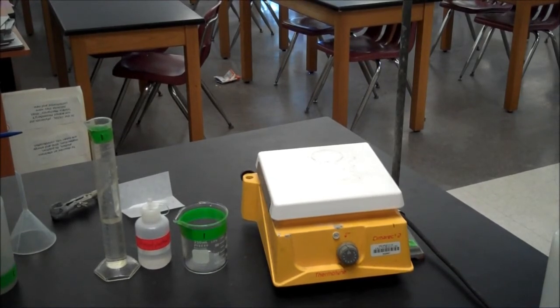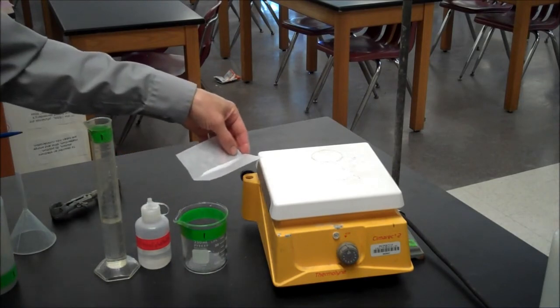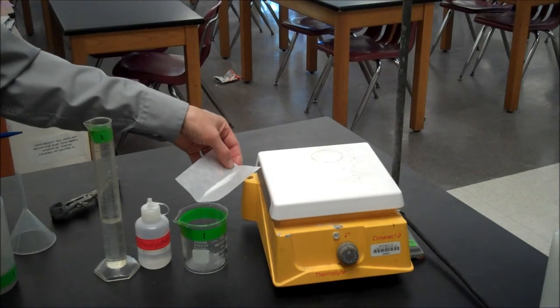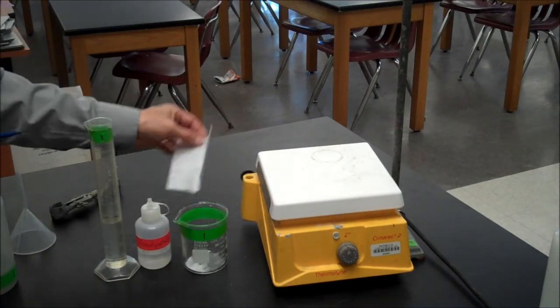The initial part of the titration lab requires you to make a solution of a weak acid in a beaker. So here's my weak acid. I weighed out the right amount, 5.00 millimoles of KHP, potassium hydrogen phthalate. Put it in the beaker.